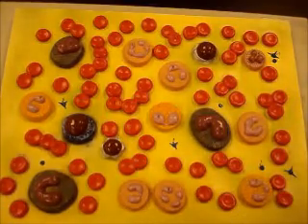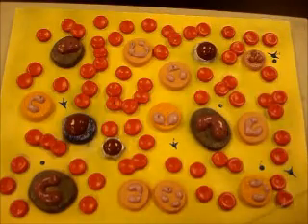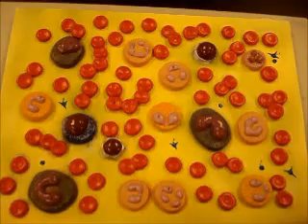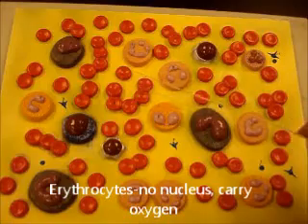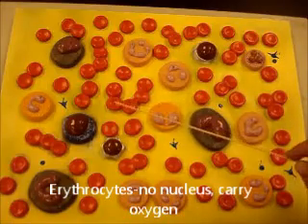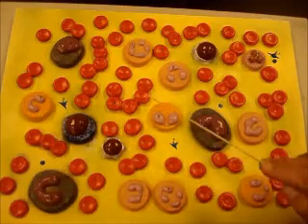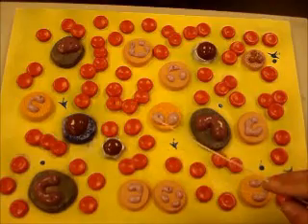This right here is showing you the model of a basic blood smear. This is what you'd normally see in regular blood. You can see here lots of red blood cells, the little pinkish looking cells. Remember, red blood cells are called erythrocytes and their main role is to carry oxygen throughout the body. And you should see something very similar when you look under the microscope.